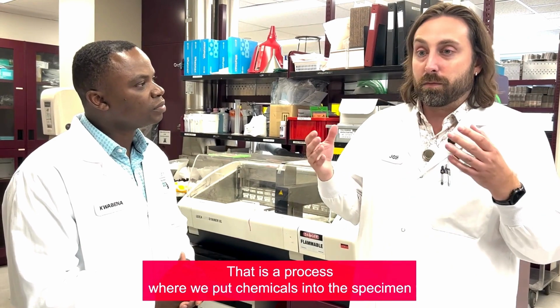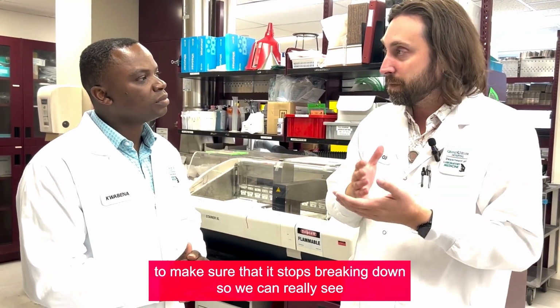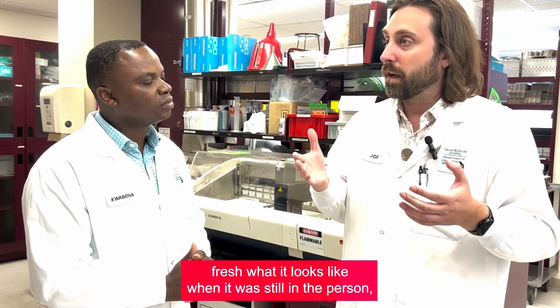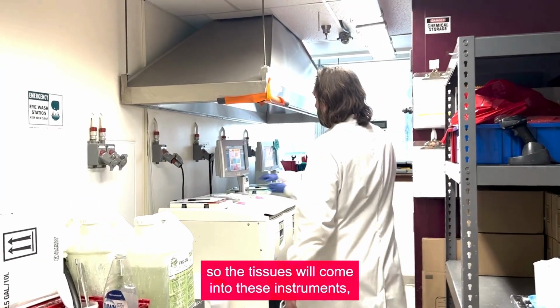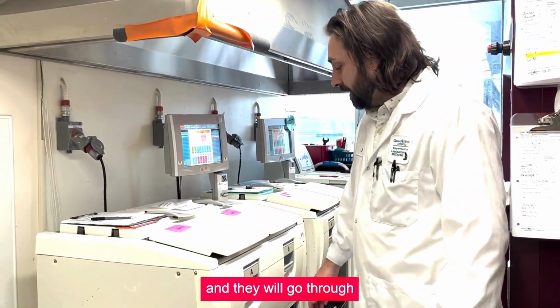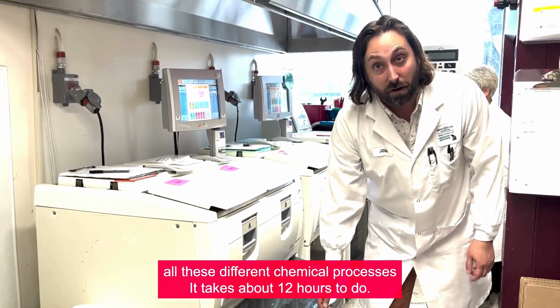That is a process where we put chemicals into the specimen to make sure that it stops breaking down. So we can really see fresh what it looks like when it was still in the person. It's still going to look that same way as it goes through our process. So the tissues will come into these instruments. They're called processors, very cleverly named. And they will go through all these different chemical processes. It takes about 12 hours to do.